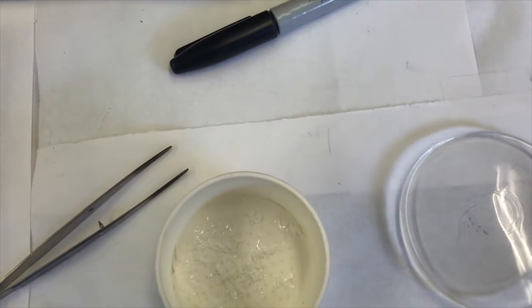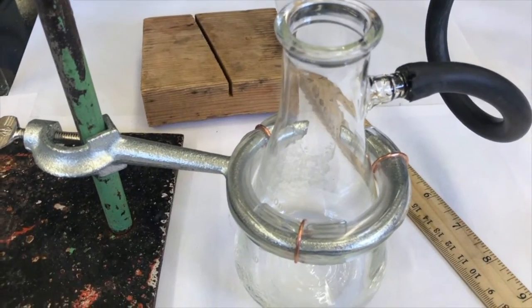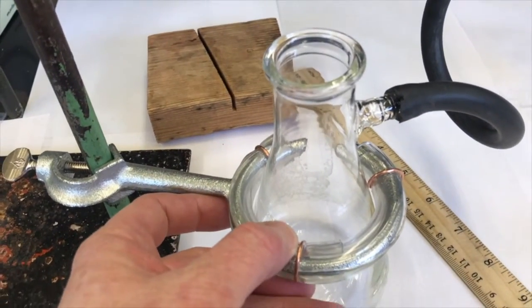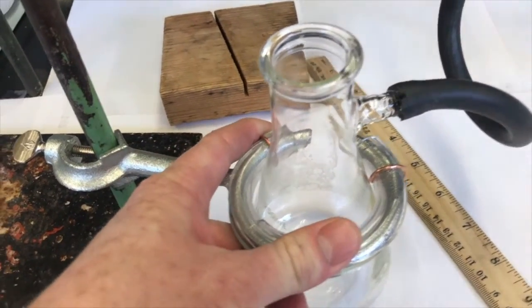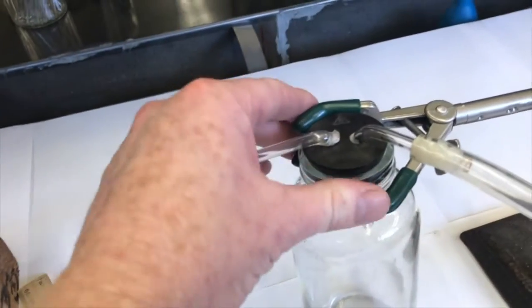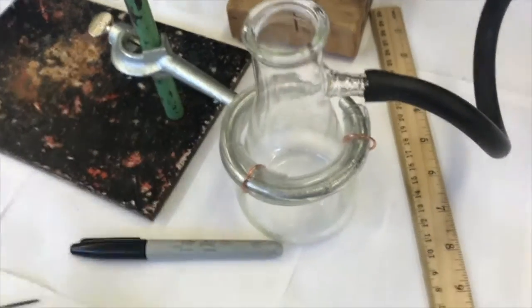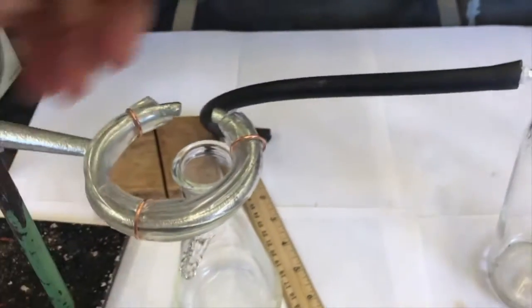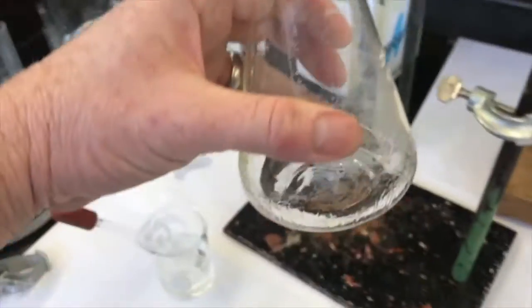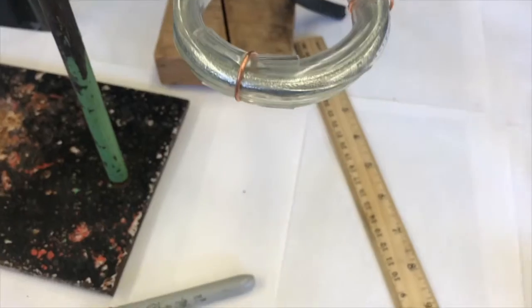I need to get something to show you that. Oh, you know what? Something else I forgot to mention. I saw this on a video. I've never done this before. I can't believe it. But a cool way to hold your filter flask or any Erlenmeyer flask is to use an iron ring like this. Works out nice, huh? I've always tried to hold it with an extension clamp. You can hold them this way too. I like it. So I'm actually going to use this iron ring to hold it while moving that. I took the hose off of the mother liquor filter flask, so I don't have to. So let's do this. Oops.